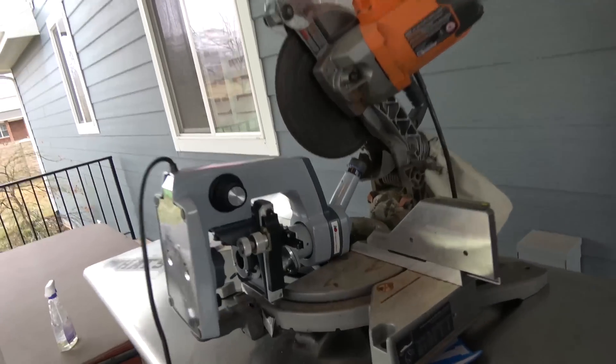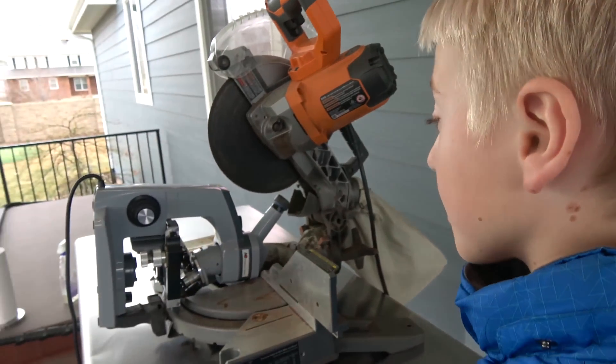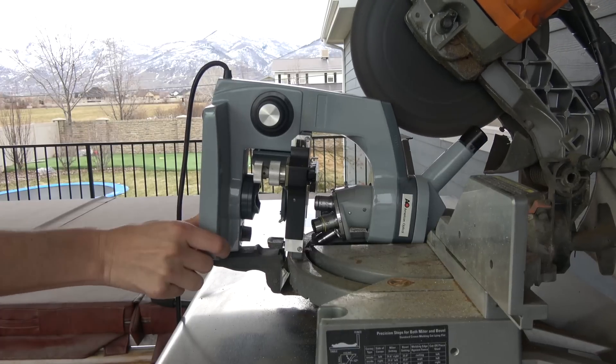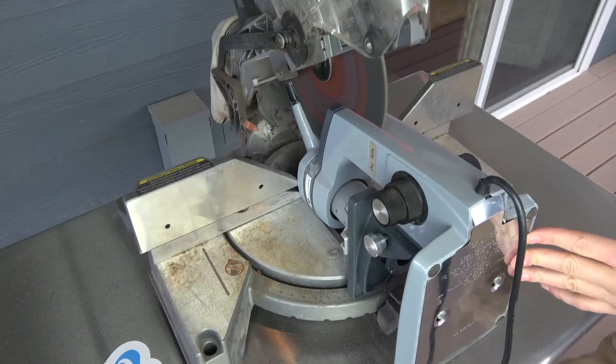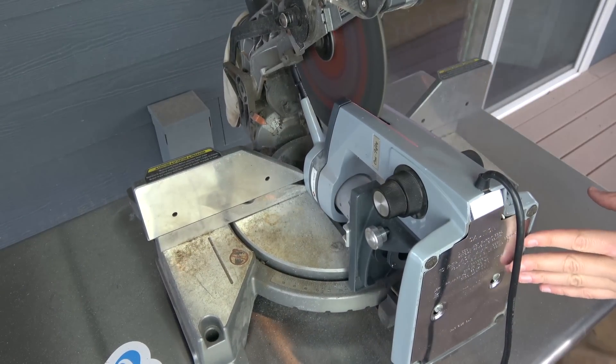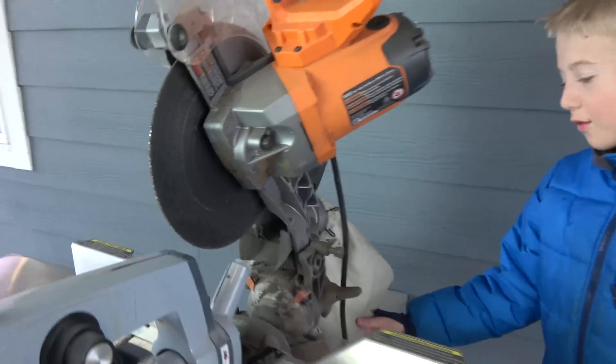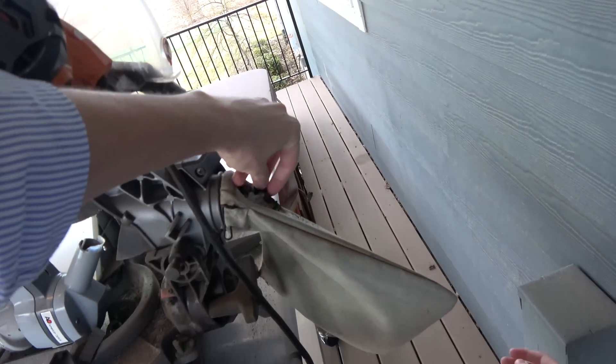All right, let's take apart this microscope and see what is inside. We got it all up on here. I turned it this way. Yeah, I think it'll work. This thing looks pretty strong. I can cut it. We lost the top. It shot in the bag. It should be right in that hole. Let's see. Oh, there it is.